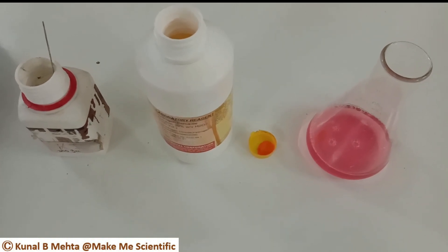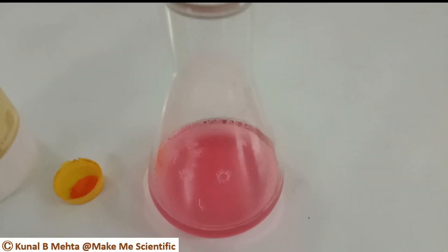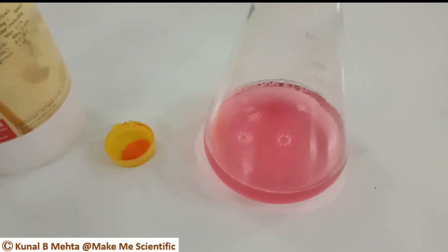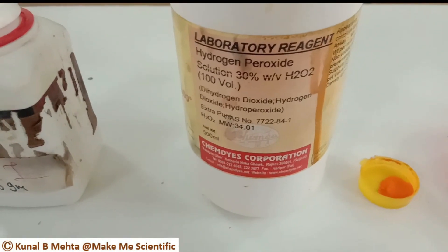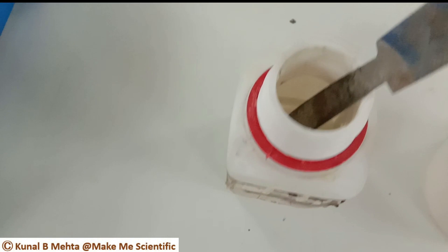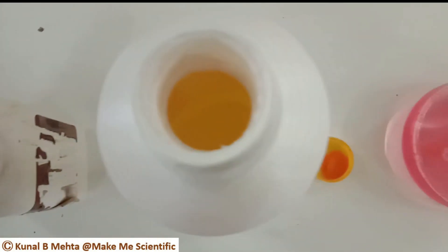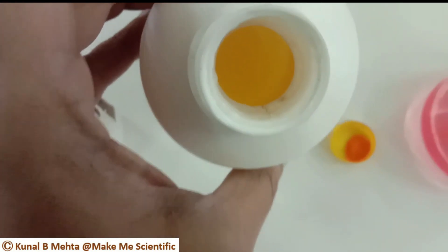It is also known as the marshmallow experiment, and all students from grade 7 to grade 12 can understand this activity. The materials are: liquid hand wash taken in a conical flask, a typical food coloring agent, hydrogen peroxide at 30% concentration, and potassium iodide powder, which is white in color. Note that hydrogen peroxide is a colorless liquid — it appears yellow here due to lighting effects.